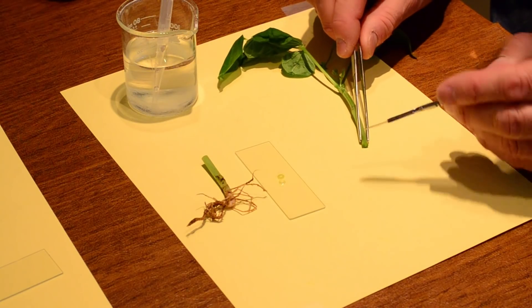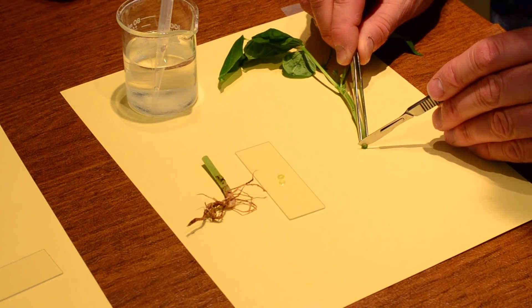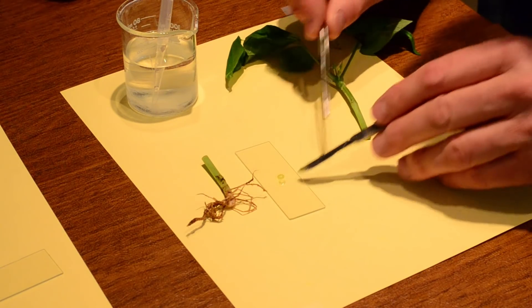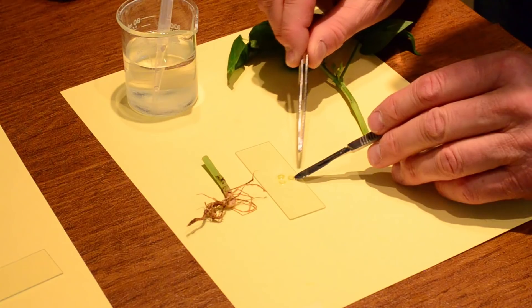I just want to grab it. I'm going to make a perfect one right here. Nice and thin. Let's see. Ah! Finally! I'm one for three.